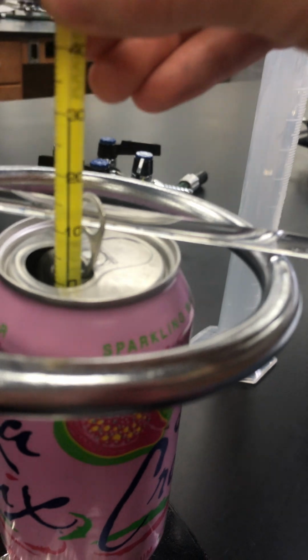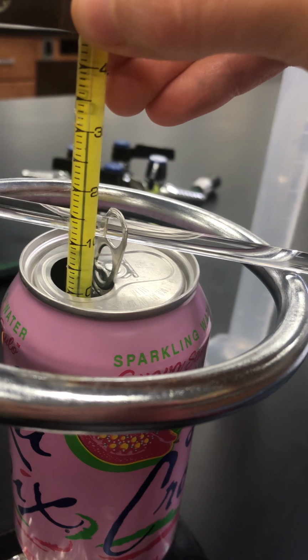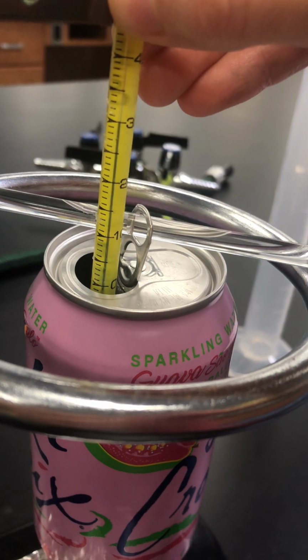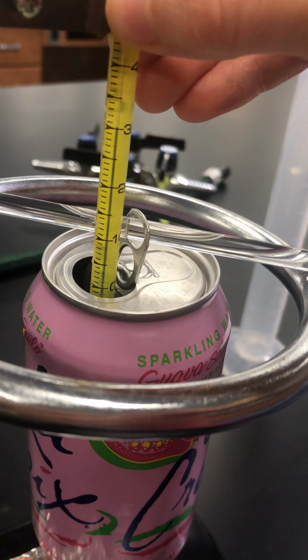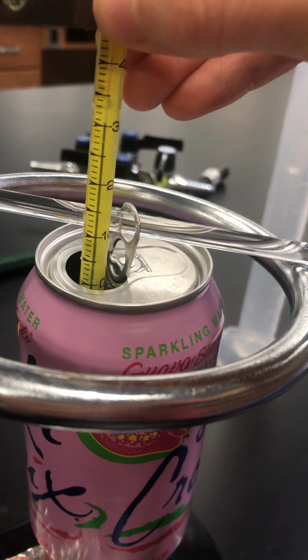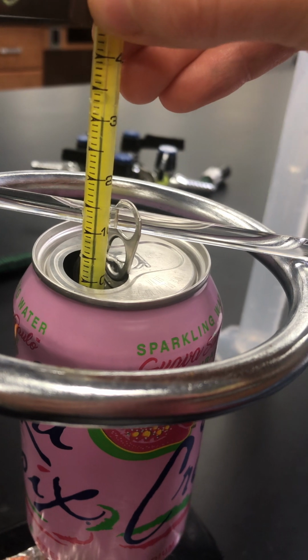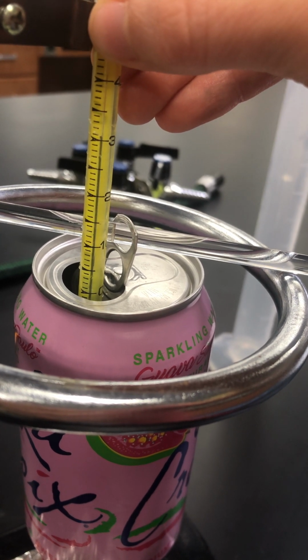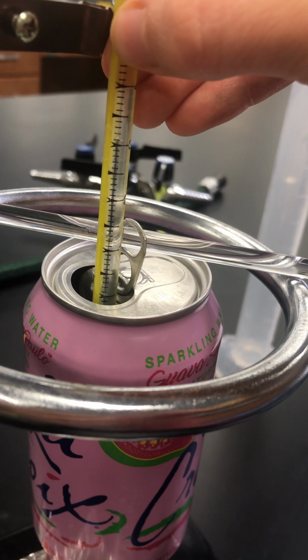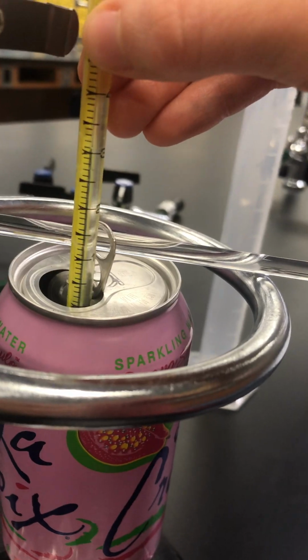All right, so it's done burning. I'm going to look at my temperature, see if it's still going up. Looks like we're right about 30 degrees right now. So let's call it 30, that's right in the middle of 30 and 31, so we're going to call it 30.5.